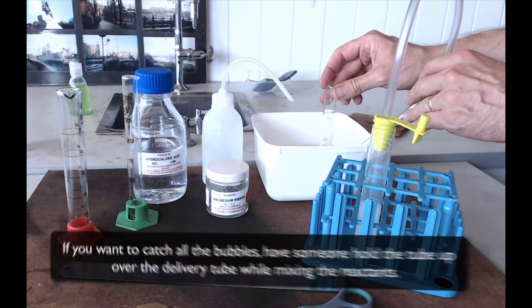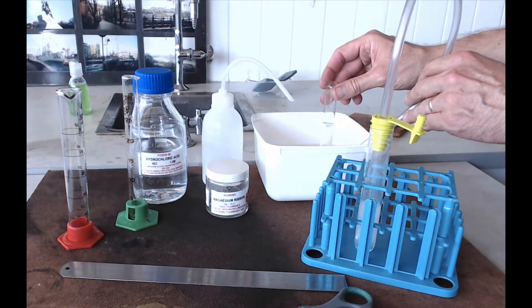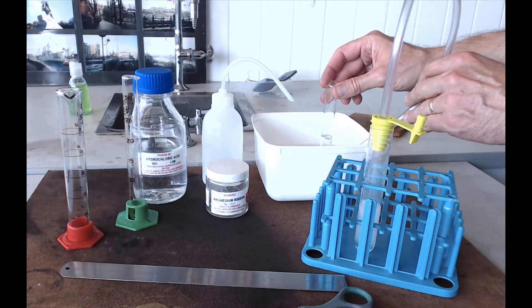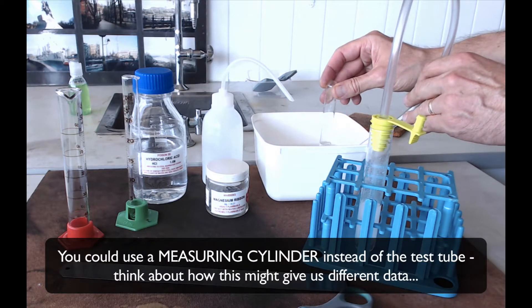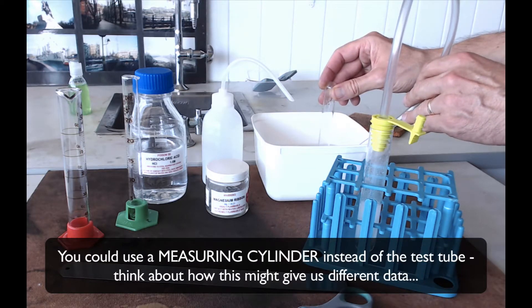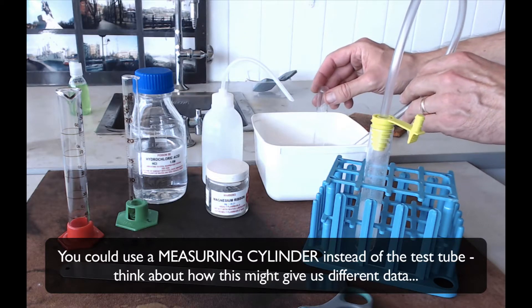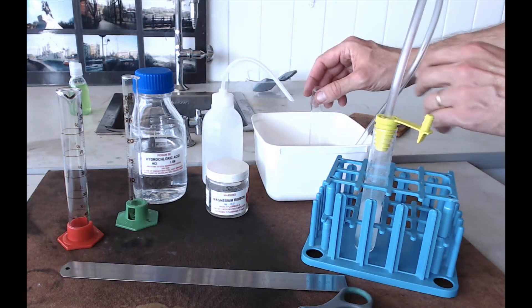And the aim, or how we're measuring the rate here, is we're seeing how long it takes to completely fill this test tube with gas. So as soon as it's full, you can stop collecting, you can stop measuring.